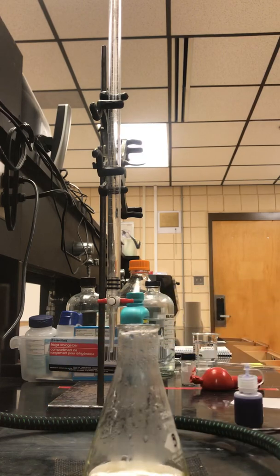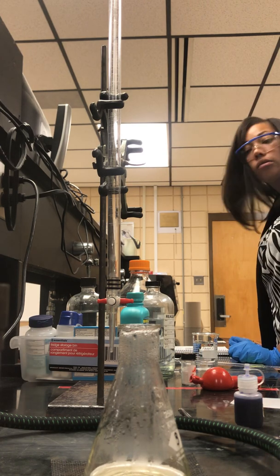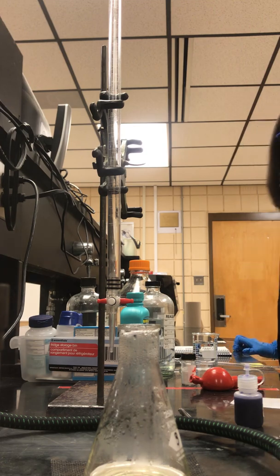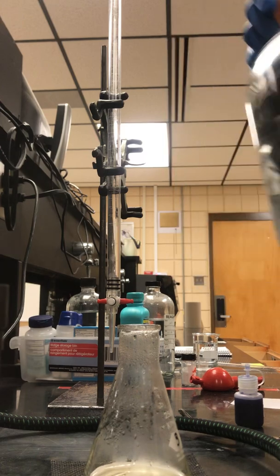Allow this to cool for a few minutes so it's roughly at room temperature. Then we want to prepare our burette by using sodium hydroxide.